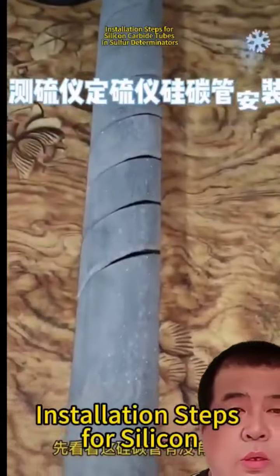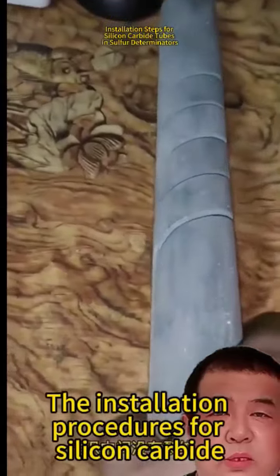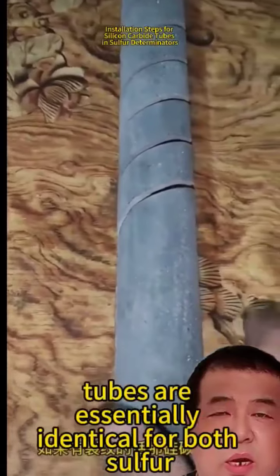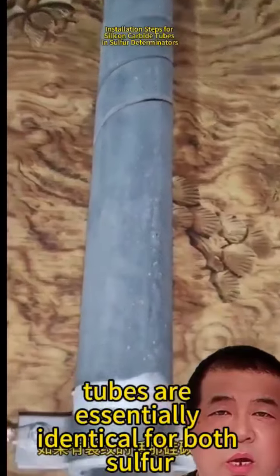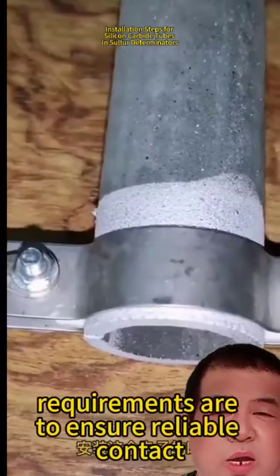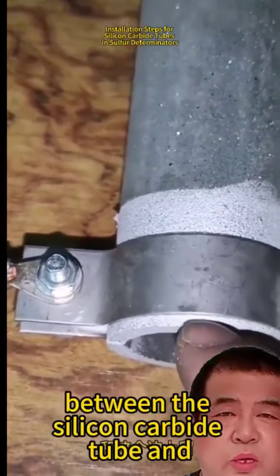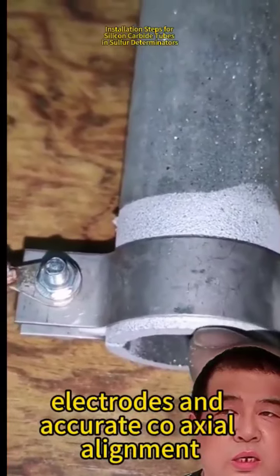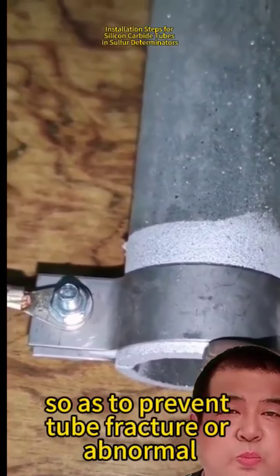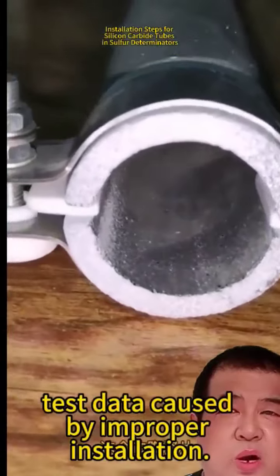Installation steps for silicon carbide tubes in sulfur determinators. The installation procedures for silicon carbide tubes are essentially identical for both sulfur determinators and sulfur analyzers. The core requirements are to ensure reliable contact between the silicon carbide tube and electrodes in accurate coaxial alignment, so as to prevent tube fracture or abnormal test data caused by improper installation.